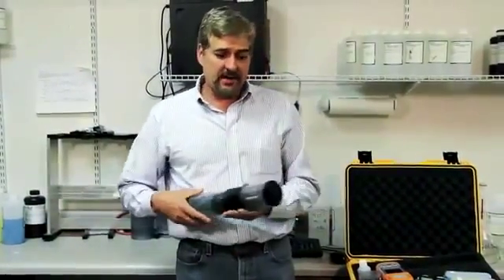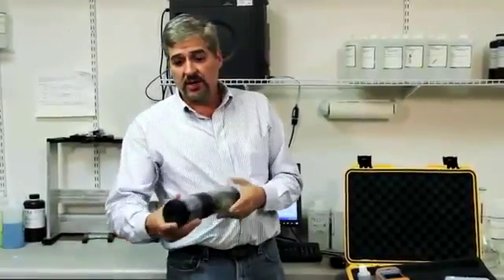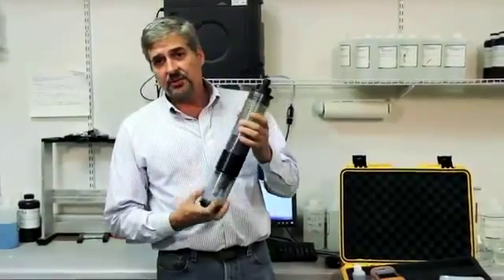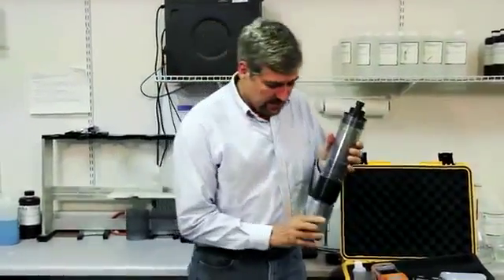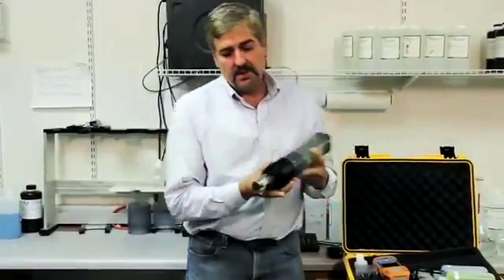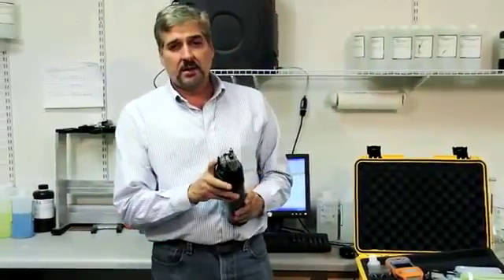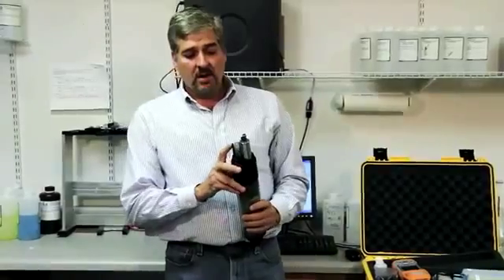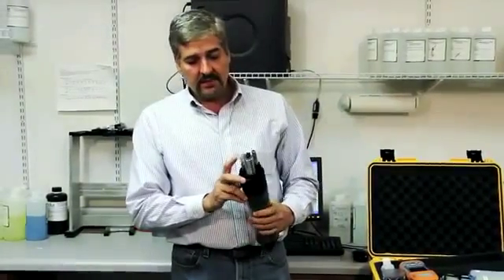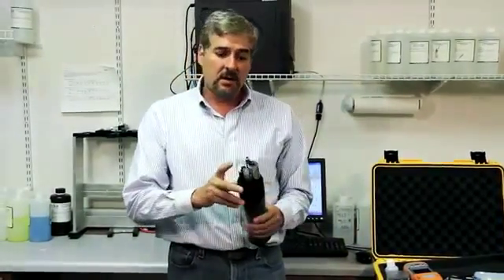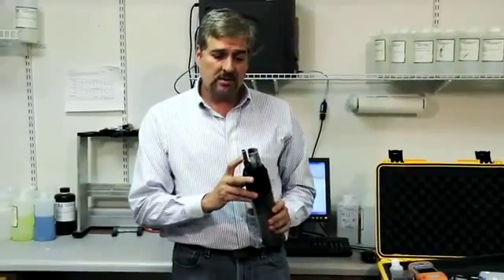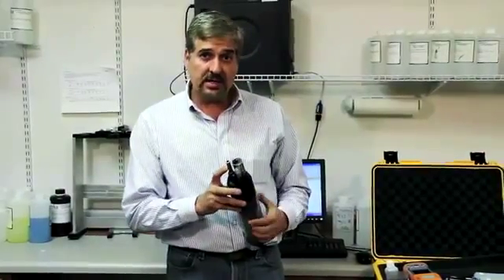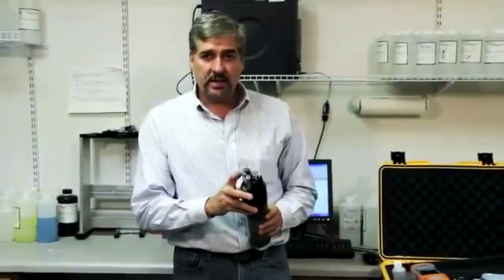Hi, my name is Gary Miller with Measurement Specialties and today we're going to talk about calibrating a Manta 2 sub 3. Manta 2 sub 3 has temperature, pH, conductivity, ORP, pH reference, optical DO both in milligrams per liter and percent saturation, and turbidity.